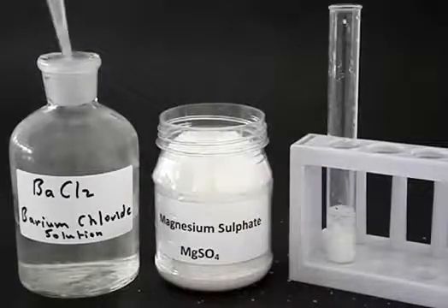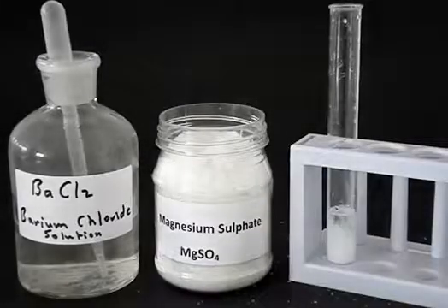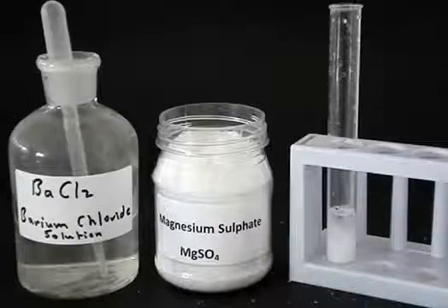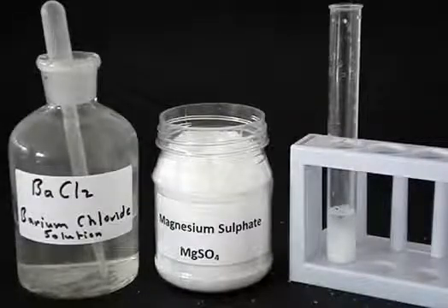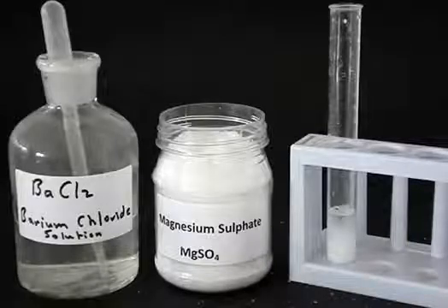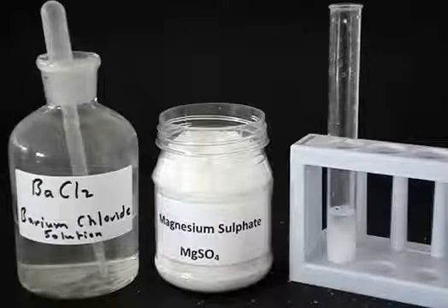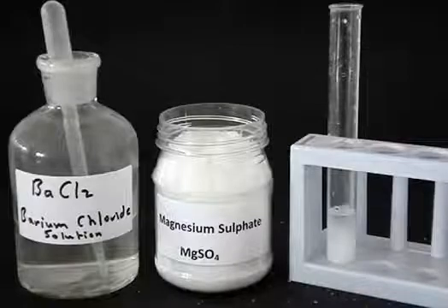The barium ions bump into any sulphate ions that might be present and form an insoluble combination — barium sulphate. And there we've seen that it's been formed. It's a white precipitate that cannot dissolve in water. The presence of that barium sulphate indicates to us that sulphate ions had been present in the original solution.